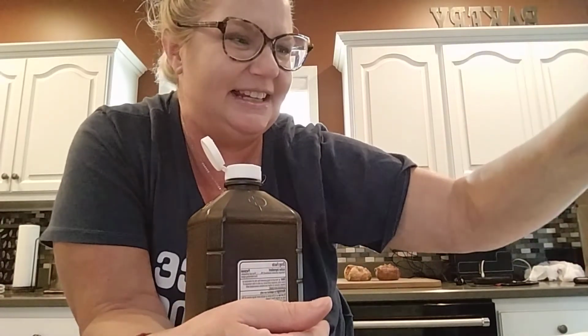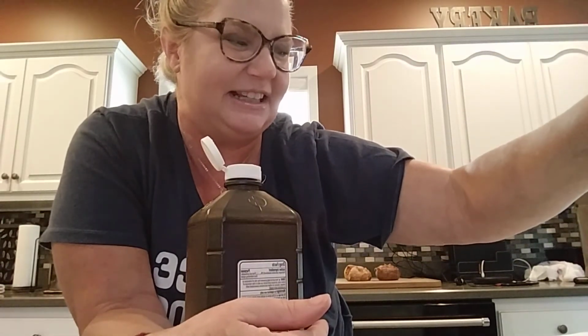Okay, so again, if you need to rewind and look at any of them and record that foam intensity from 0 to 5, that's going to indicate how well that catalase was working, breaking down that hydrogen peroxide to water and oxygen, because again, it's speeding up that reaction. That reaction would happen regardless. It's just that enzymes speed it up.